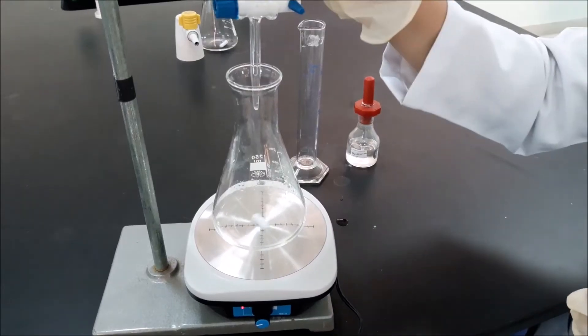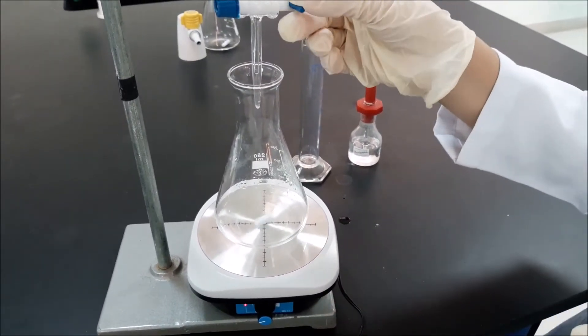Initial reading of our sodium hydroxide is 0. Let's start the experiment.